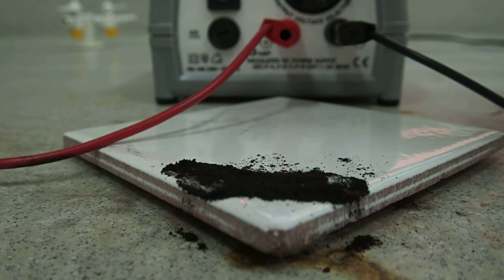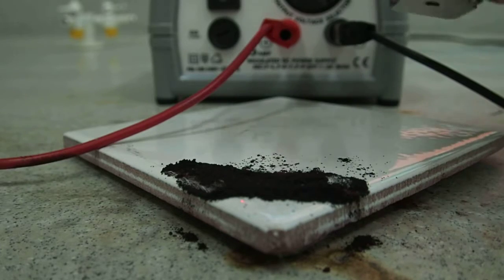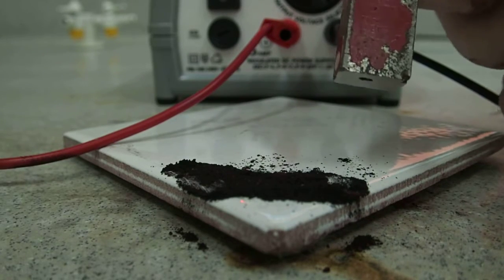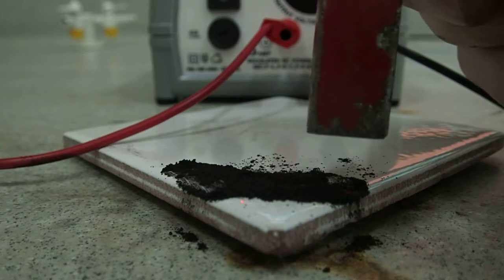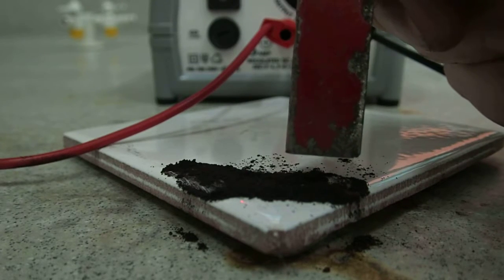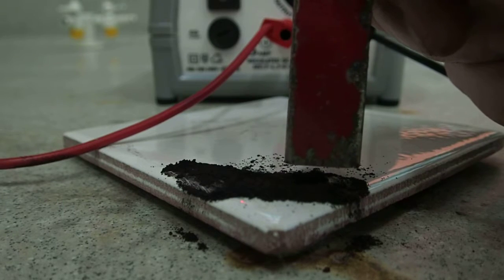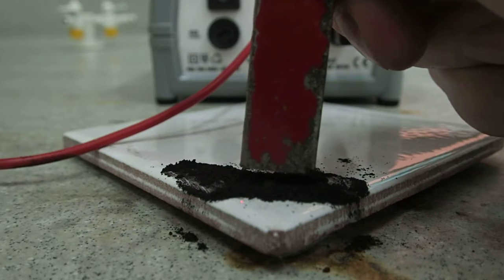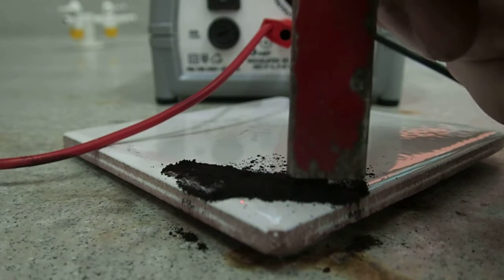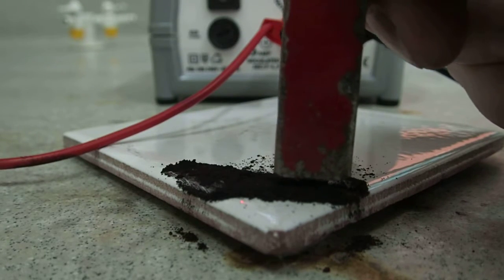The end test is to see if we can pick up anything that's magnetic in the reaction mixture, indicating the presence of iron. So again, once more, we run the magnet close to the surface, and you should see some materials start to leap up onto the magnet—little specks of iron being formed there in the mixture.